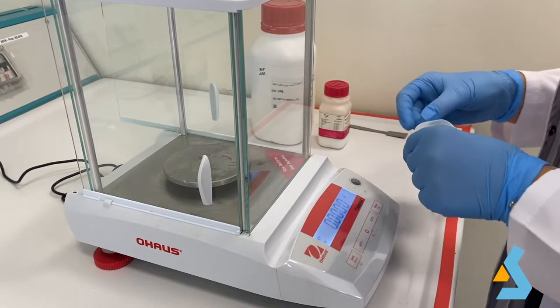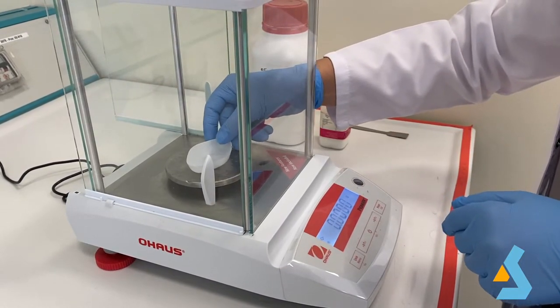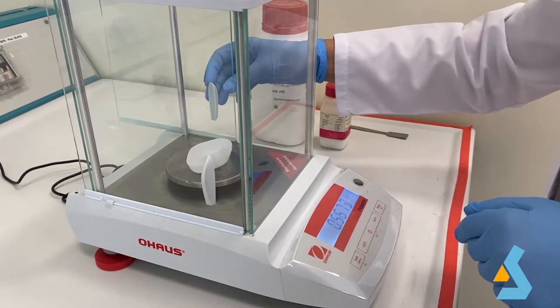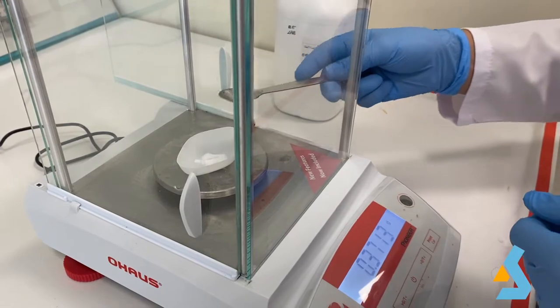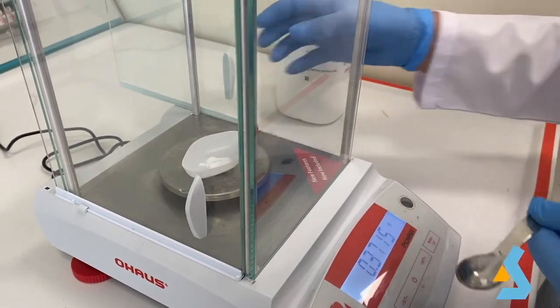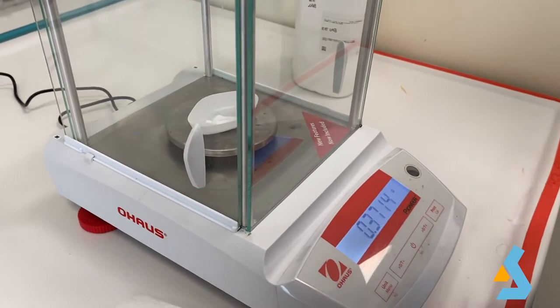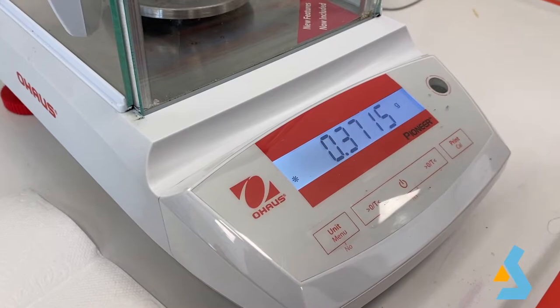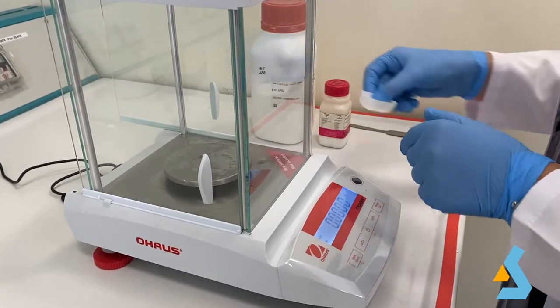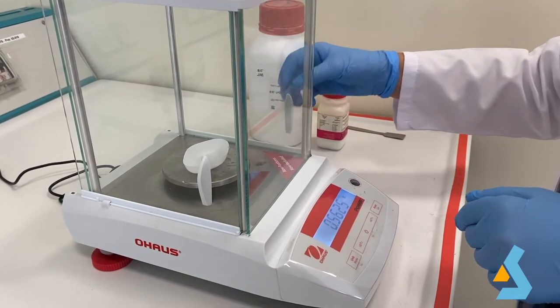To measure a small amount of chemicals down to just a few milligrams, we use precision weighing scales. The scales are so sensitive that they can even be affected by the movement of objects around them. You need to close the door above the scale to have a more precise measurement. In order to make sure the measurement is accurate, you have to wait until the asterisk shape sign appears. This sign indicates the measurement is finalized. Just before you start your measurement, you need to tare the weighing plate to eliminate its weight. Then you can begin measuring.